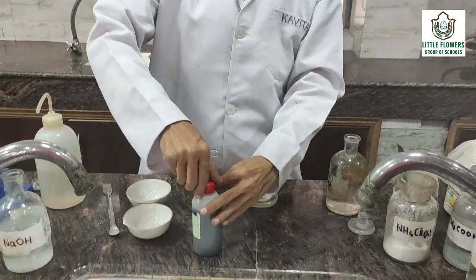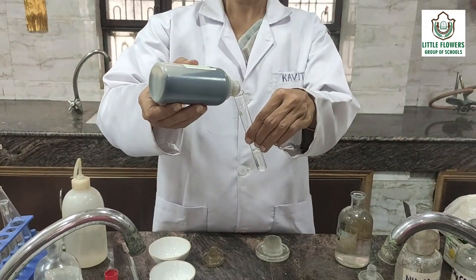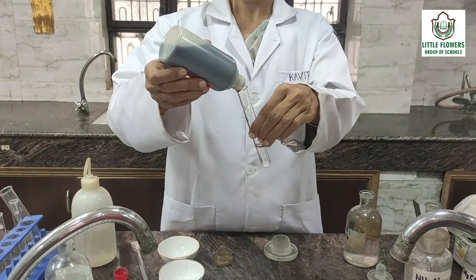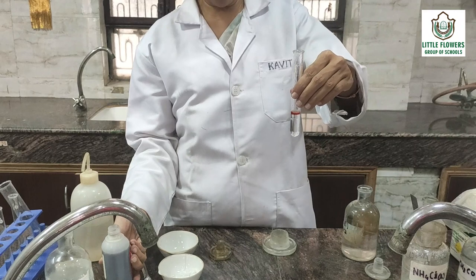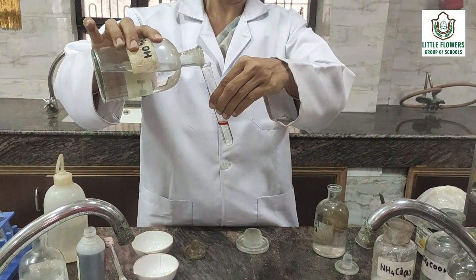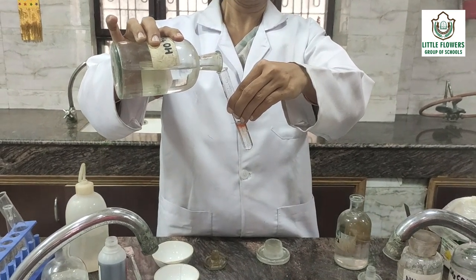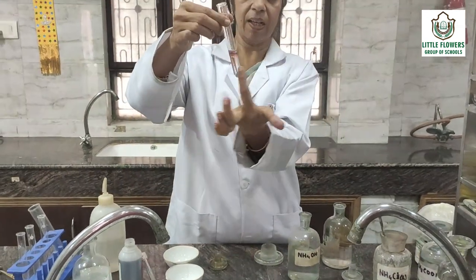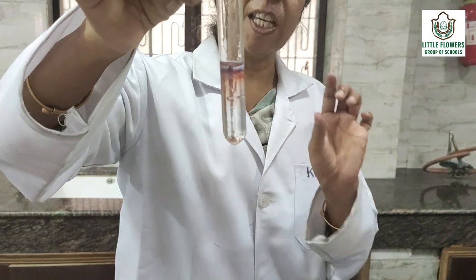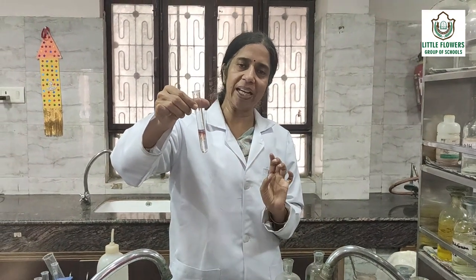Now we will do the confirmatory test. We will add drop by drop blue litmus solution — just a few drops. After adding blue litmus solution, we will add NH₄OH in excess. Now you see the blue gelatinous floating PPT has come. This blue floating PPT shows that in the given salt, Group 3 aluminium radical is present.